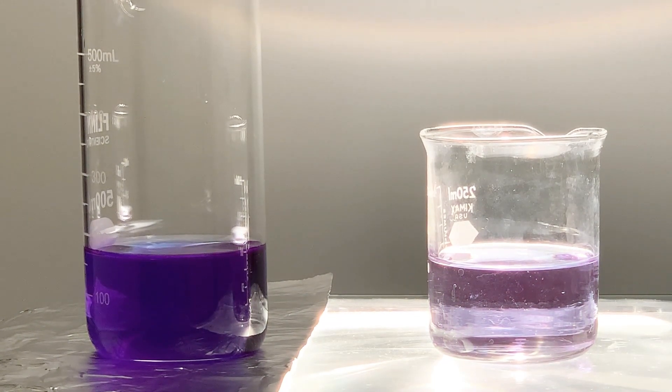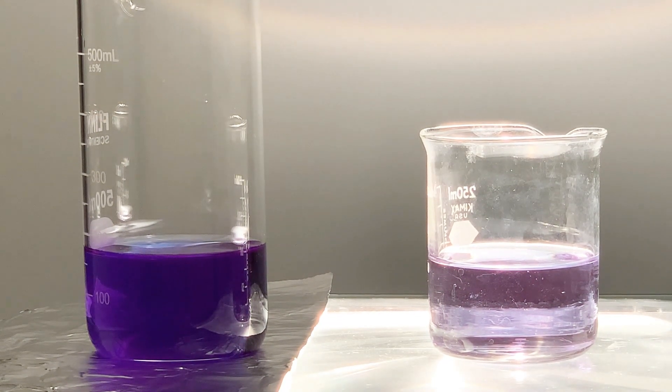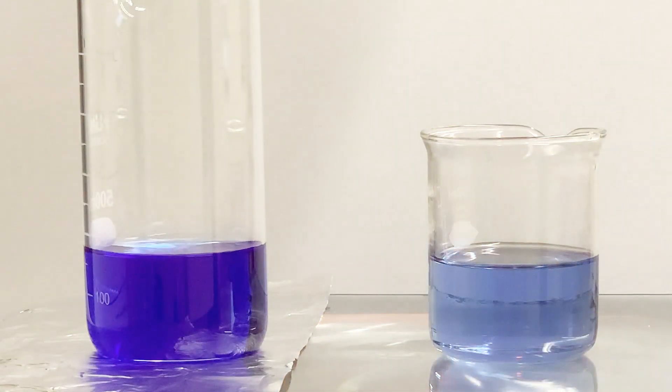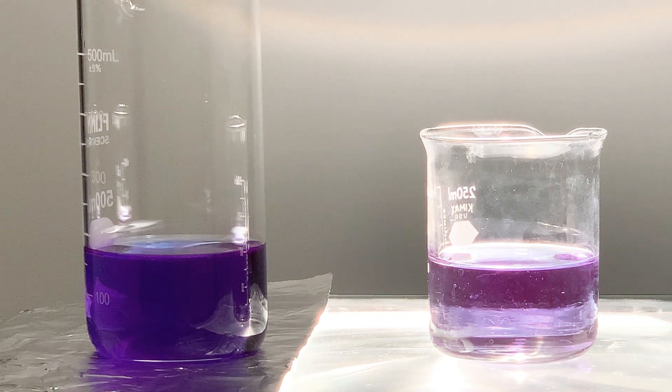It looks to me like the thionine dye is fading. What do you think? And when I turn the light off, the blue color grows back in. This process can be repeated many times.